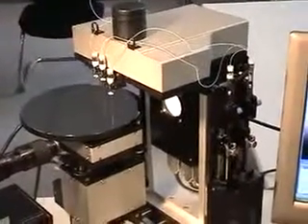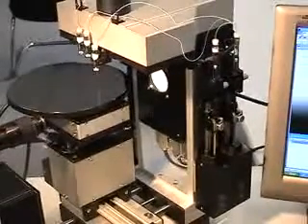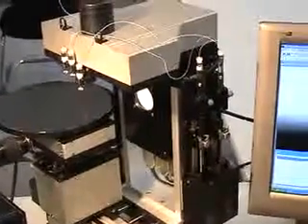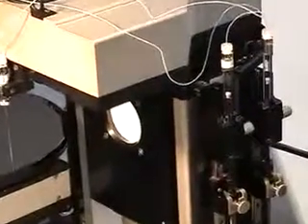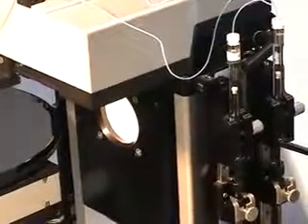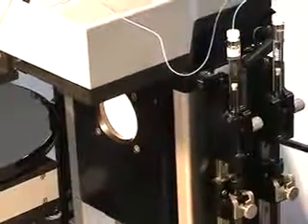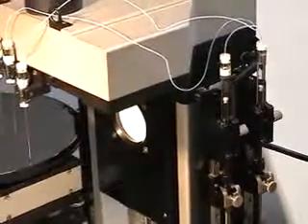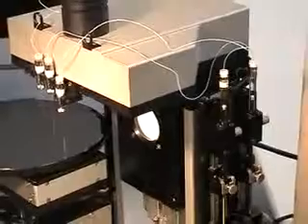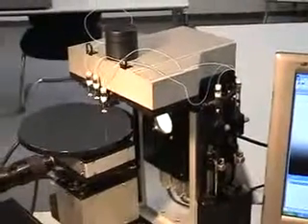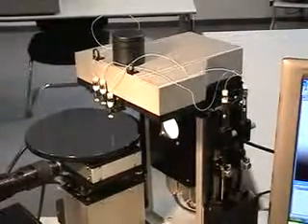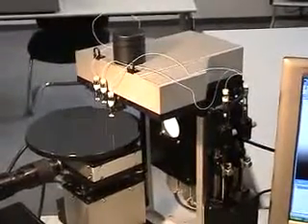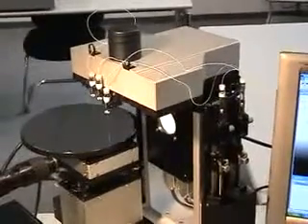Typically those electronic syringes are being filled with water, diiodomethane, and ethylene glycol. In the next step we will show how to assign operating procedures to the instrument to perform a surface energy analysis. In the second stage of this movie we will also show how to dose more viscous liquids, for example resins, with a higher viscosity of several Pascal seconds.